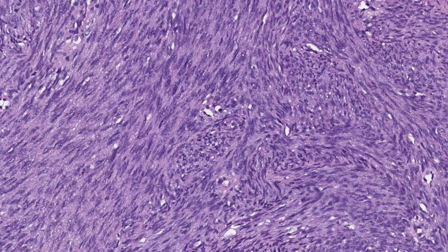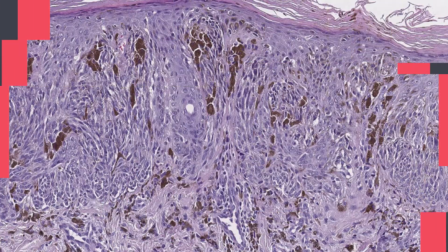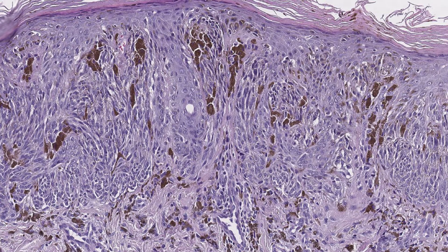Eosin binds with acidophilic substances, such as positively charged amino acid side chains, so as a result the cytoplasm is pink or orange.